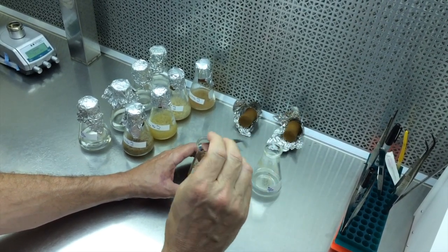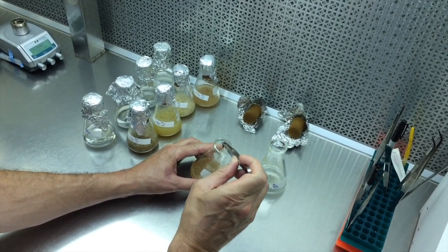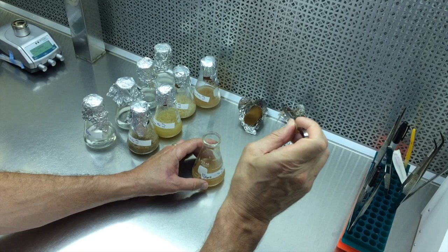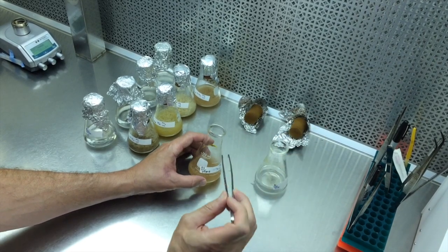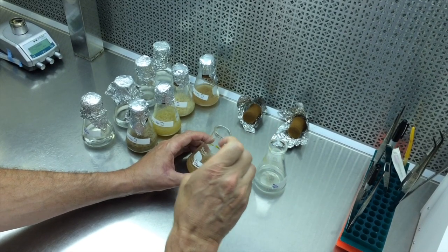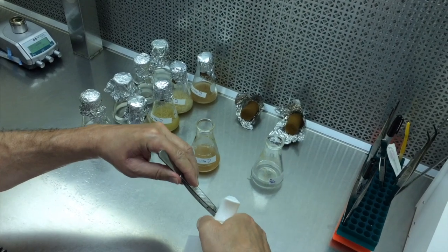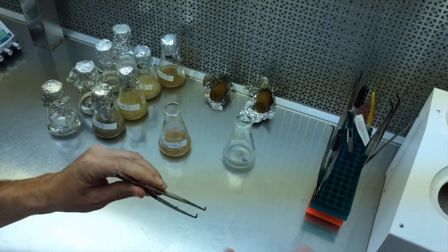And I make a bit of a judgment call on how fast they're growing, how much I want to take over. I usually take three little snips like that. By going in on the surface, down under the surface, a little bit towards the edge, tends to be the most recent growth. This takes off any sugar that's on there.